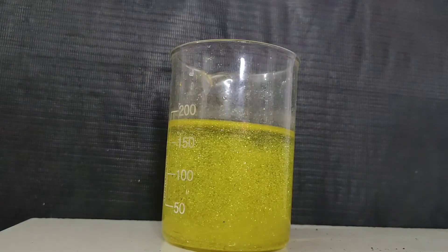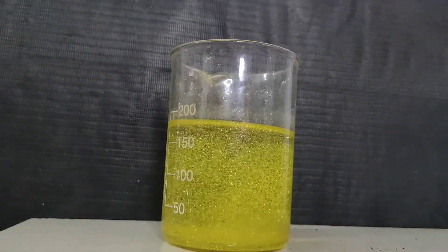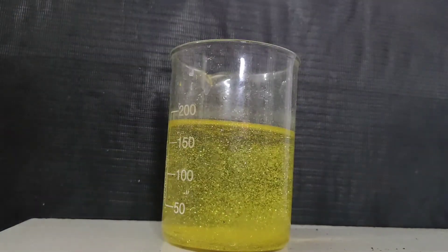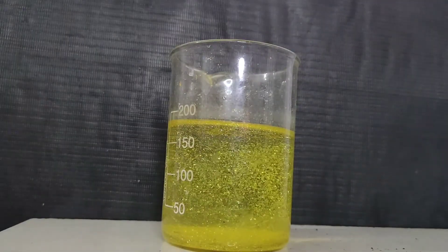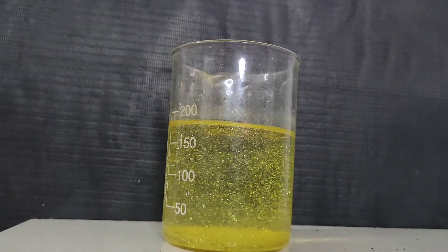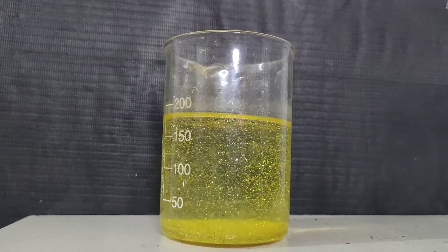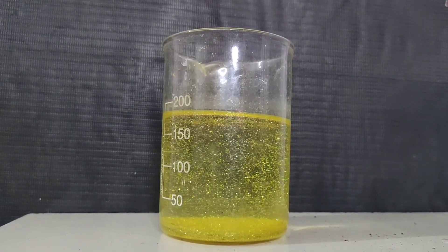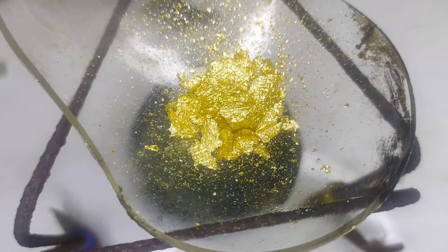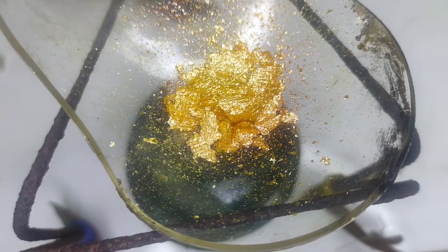Slowly and gradually the crystals start to sediment. Afterwards I filtered off the solution and dried the crystals. After drying the crystals, I took them onto a glass plate and heated them.